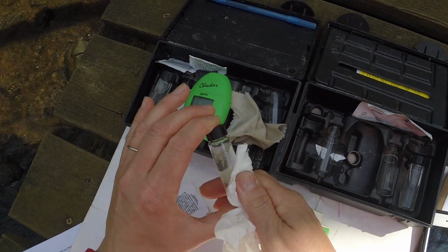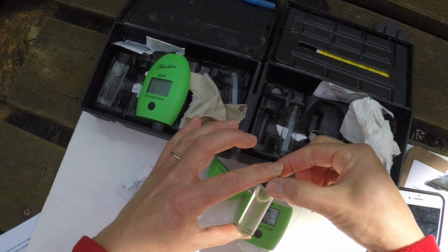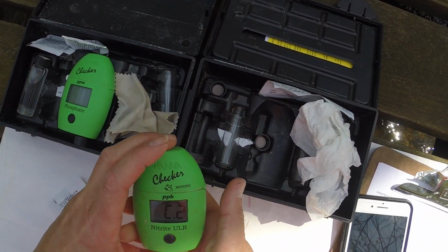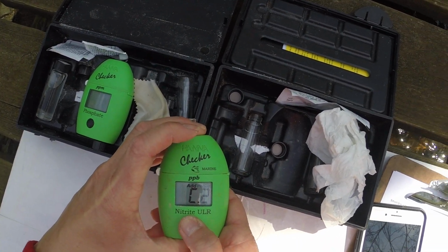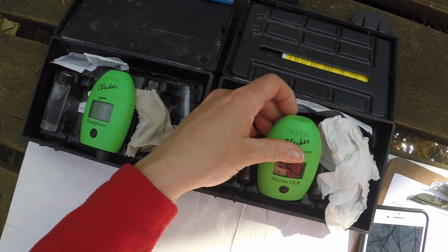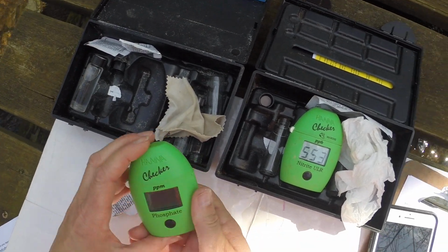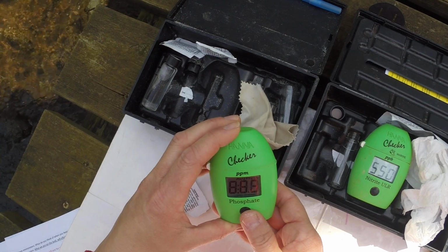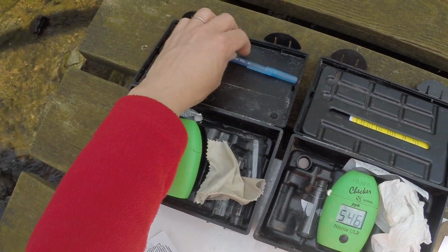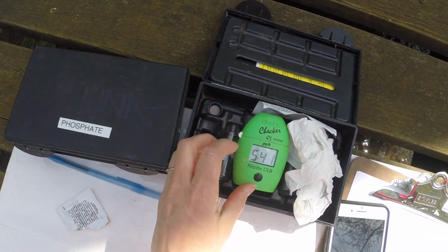So I have to mix it so that it's dissolved. Okay, and then I clean off the cuvette, the glass container, so it has no fingerprints on there that could affect the reading of this. And then I hold the button down for the timer. Okay, so that's 6 minutes. I will do the phosphate later then, because for some reason, yep, that one's not working. So we'll do phosphate later, with a different portion, and we'll get that.